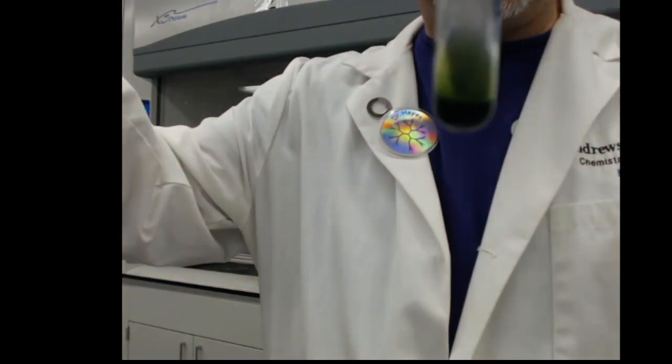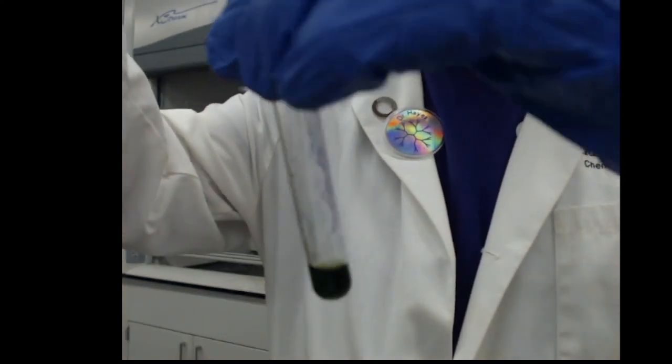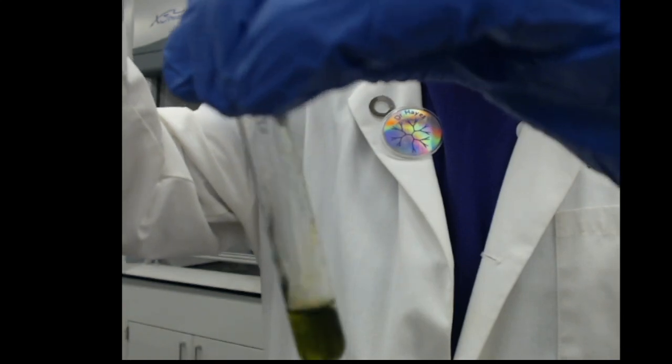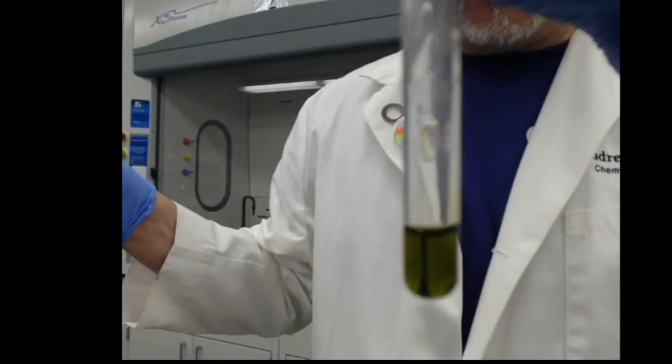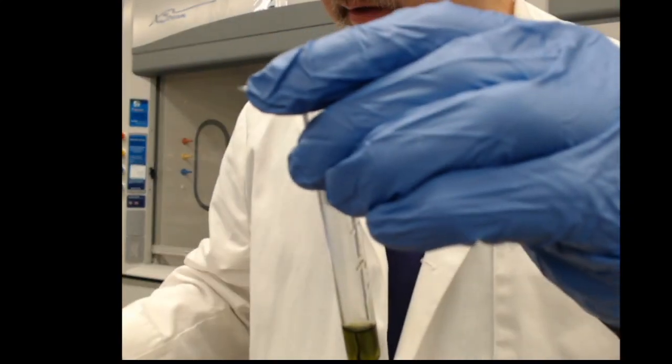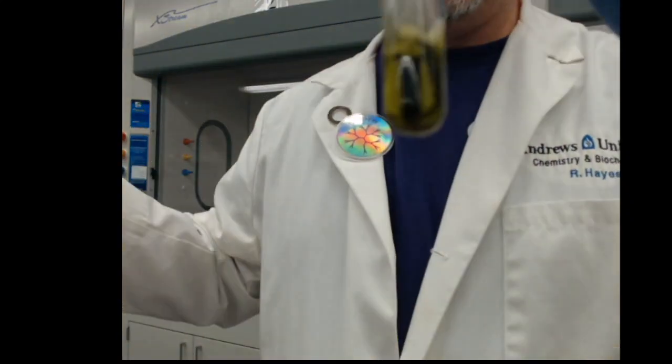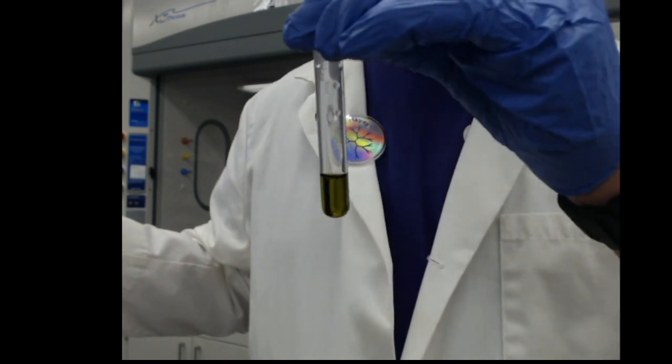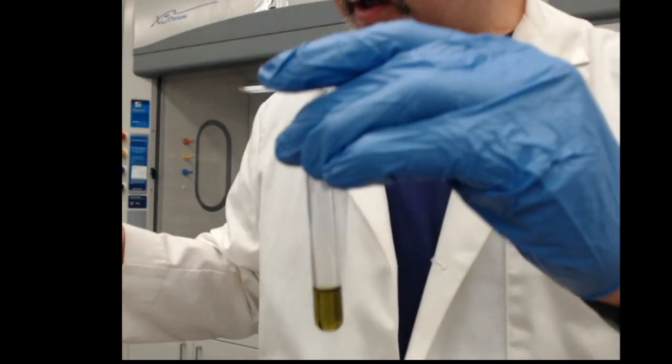Put a little bit in there and I'm seeing some green color. I'm going to keep adding a little bit more there. And we're seeing now a yellow color. Maybe just a few more drops. And it shifted to a nice yellow color.